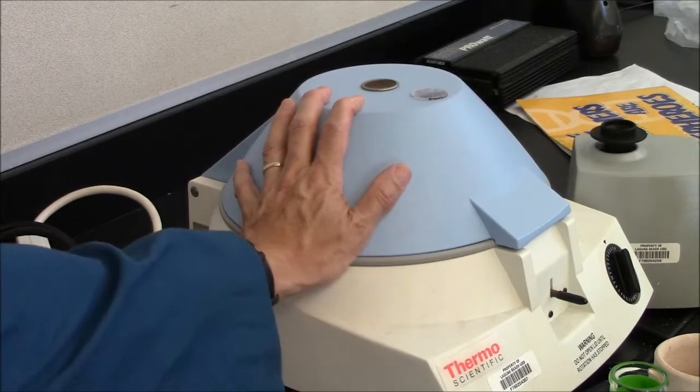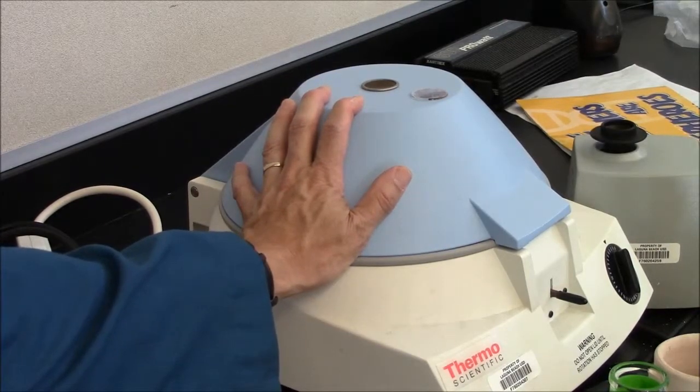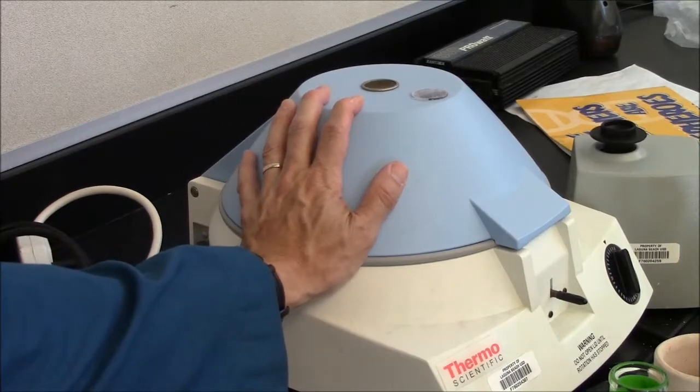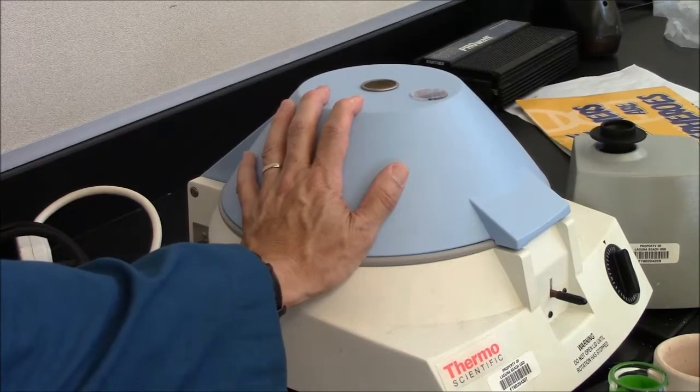I can put my hand on this to feel the vibration. If I balance the tubes well, it will be smooth. This is pretty good.